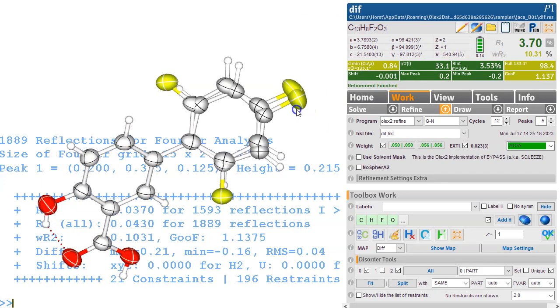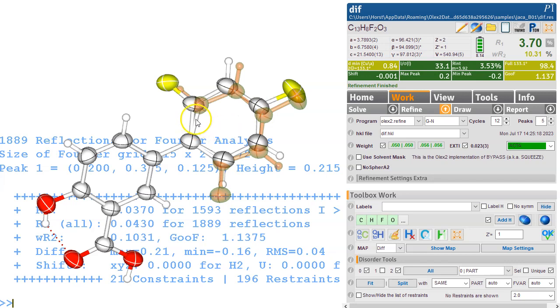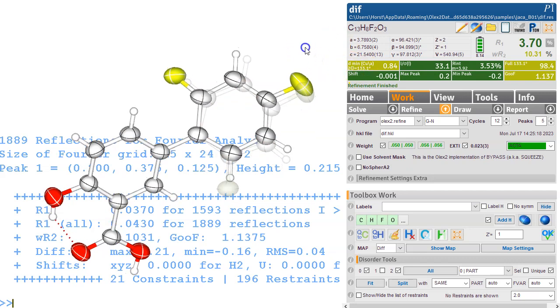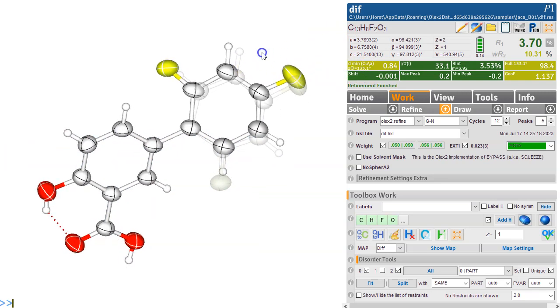Okay, yeah, but if that's a model that you would like, so we go sel part 2, sel atoms bonds, and we haven't selected those two, so we need to do this manually at the moment. And then group minus n equals, something that I've defined that makes it semi-transparent, and then clear, so we don't have a background, so we have a picture, an alternative picture of this molecule. Thanks for using OLEX2.